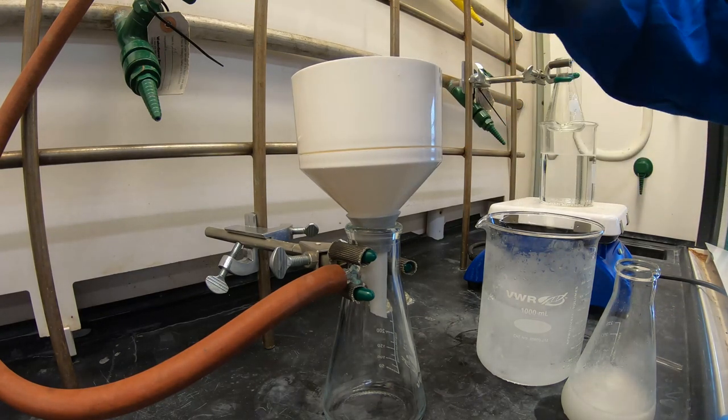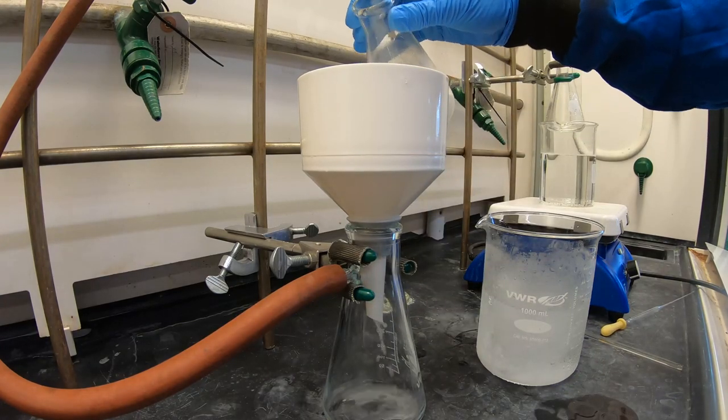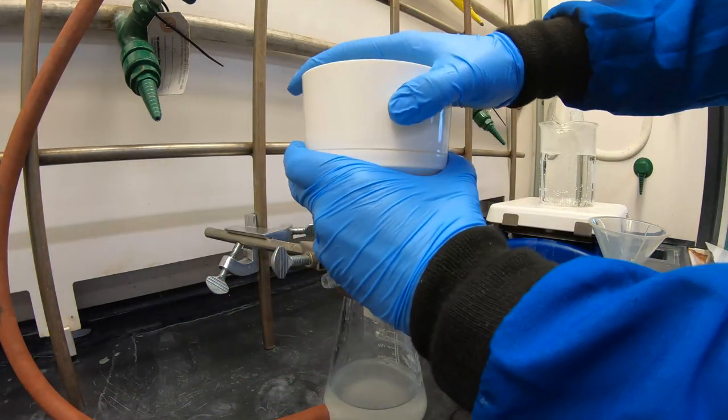Once you've formed a fair amount of crystals, vacuum filter the lidocaine crude. Rinse with cold water. Continue to pull air over your solid for 15 minutes so that it is dried.